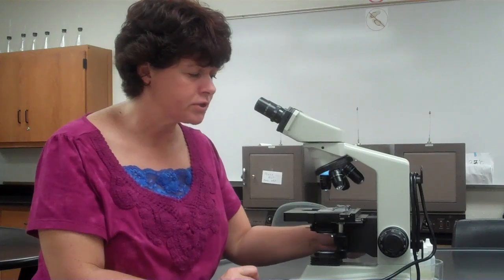The other thing that you want to look at is right here is the condenser. Sometimes the condenser is way down here and you will have focusing issues if you don't have it in the right place. So you're going to want to put it to where it's pretty close to the slide, right below it, okay? Now we are dealing with bacteria that are very, very small. So we do not need to worry about the 4x power. We're just going to skip that. We're always going to start with the 10, okay? You will have to find the organism, find the smear with the 10 power before you go any further, okay?